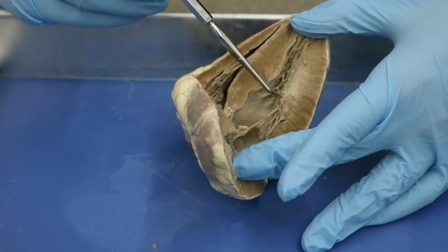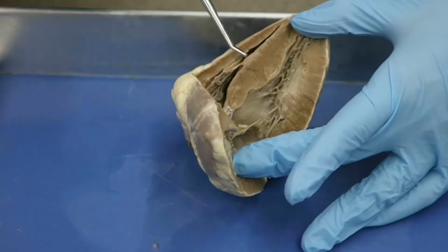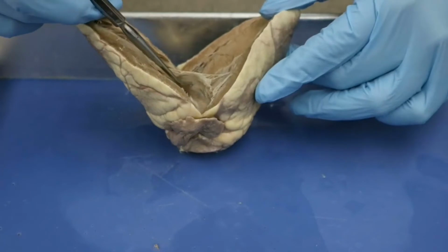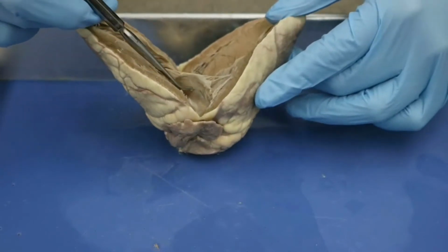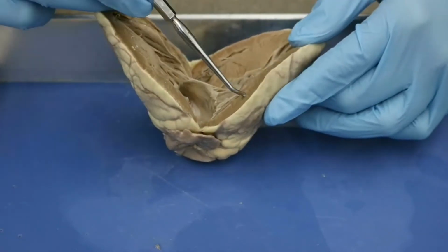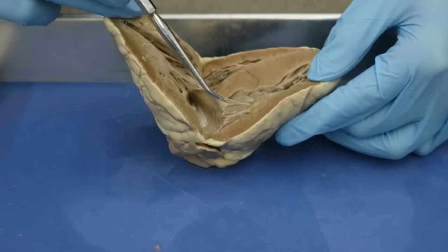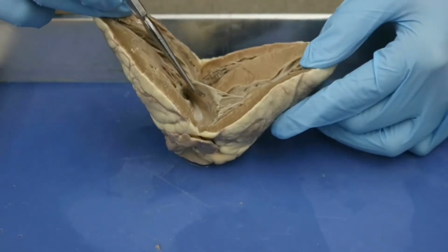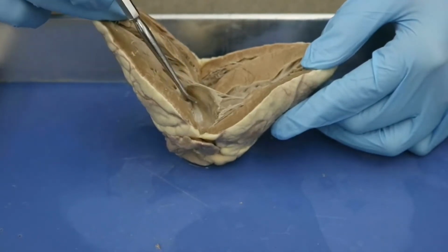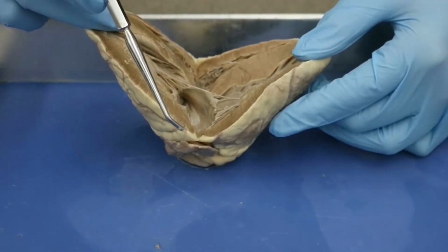Okay, remember your papillary muscle is going to contract, and when it does so, it pulls up on the chordae tendineae, and that deals with this fleshy tissue here. So what would this fleshy tissue be? A valve, right? But this valve is associated with, we can see here, the thicker walled left ventricle. So this is going to be your mitral valve, okay? All right, so I'm gonna go ahead and pause the video for a second so I can cut this a little bit better, and then we'll continue.